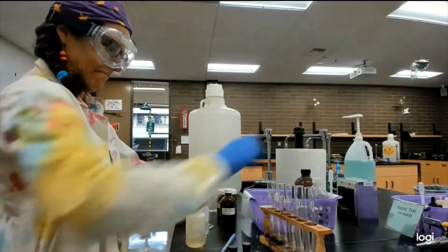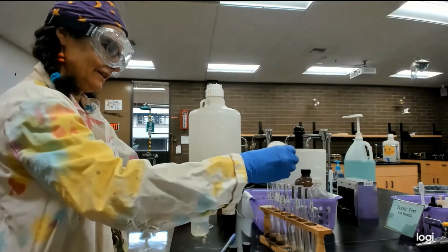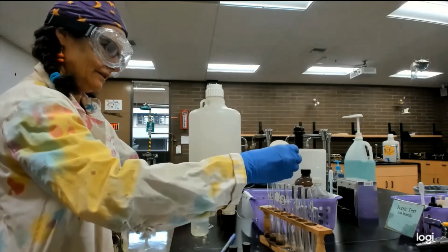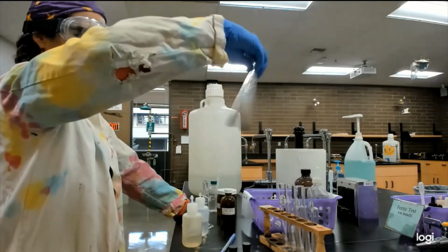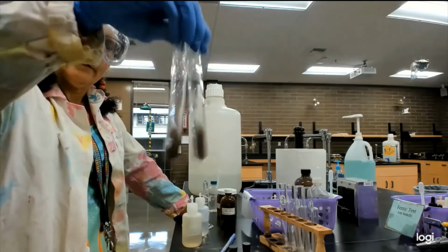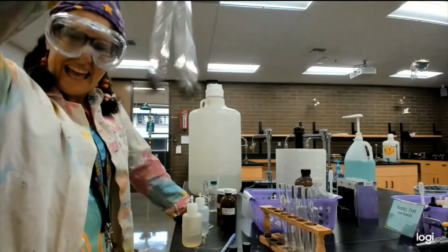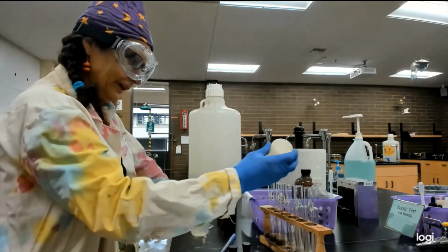All right. Oh, the smell of ammonia. It just looks like it's getting muddier. I think this is what my students go through, and I'm like, just keep going, just keep following the directions.